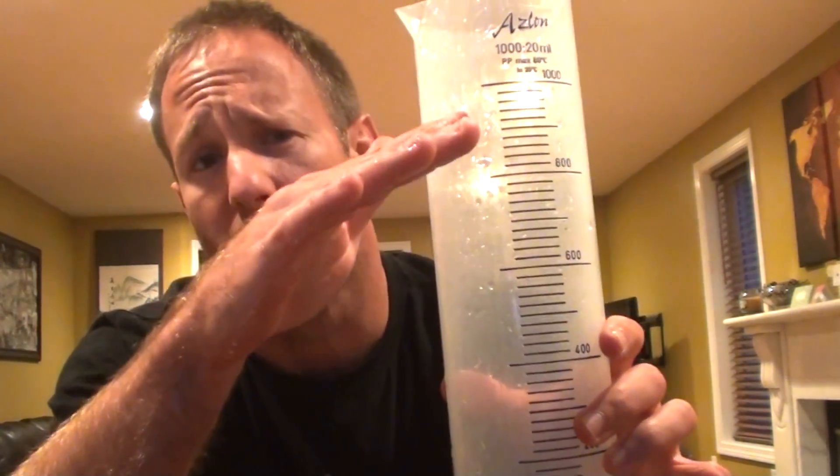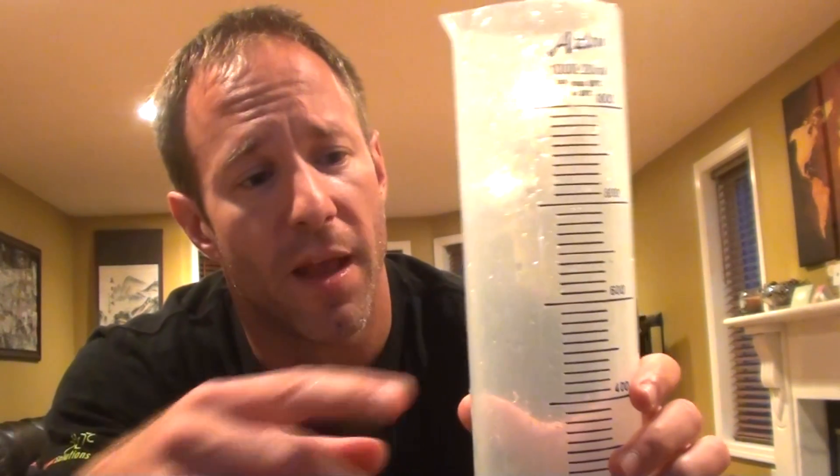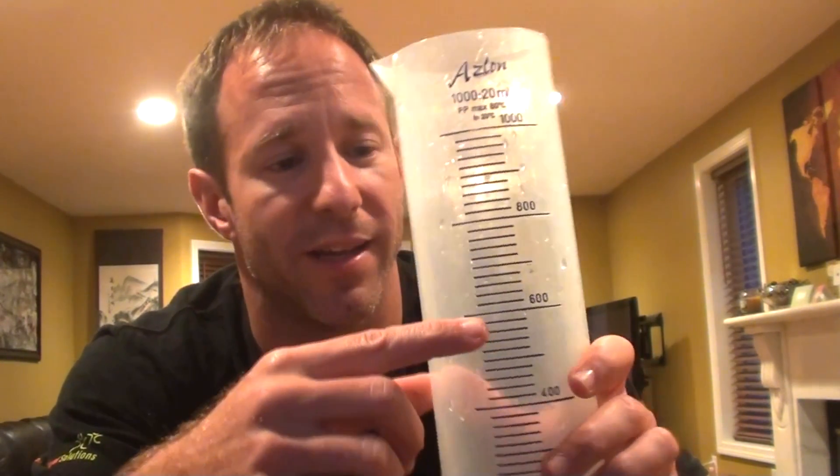Next I need to add some water to this graduated cylinder. I often tell students to fill it about a third to half way. You don't want too much because the water overflows easily, and you don't want so little that the object won't be fully submerged. Do not try to get an exact number — students often waste time trying to get exactly 600 or 400 milliliters, adding a little more, dumping some out, adding more. It's not necessary. Just do about a third to half way.